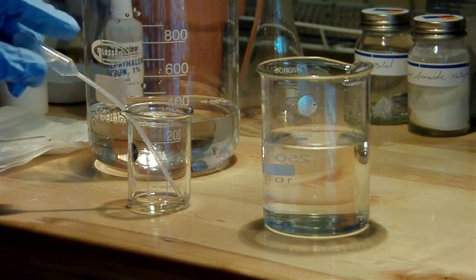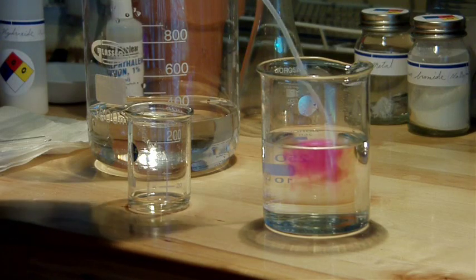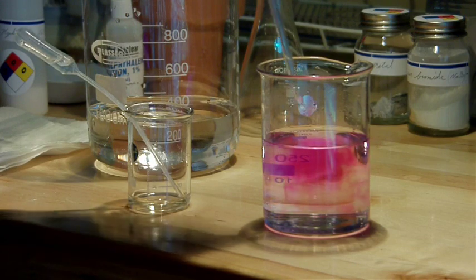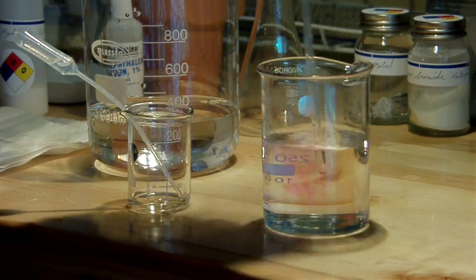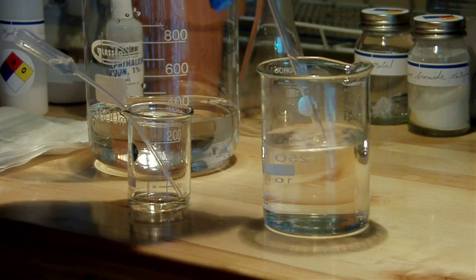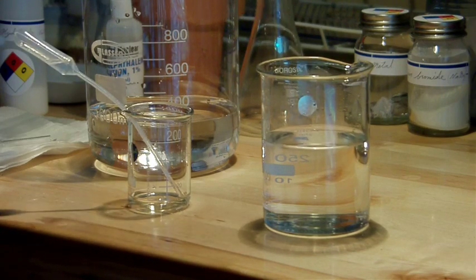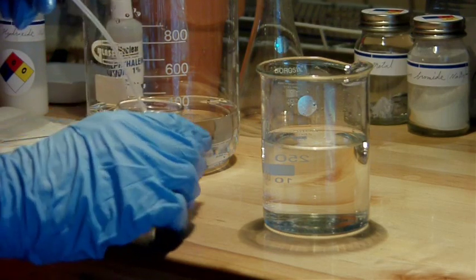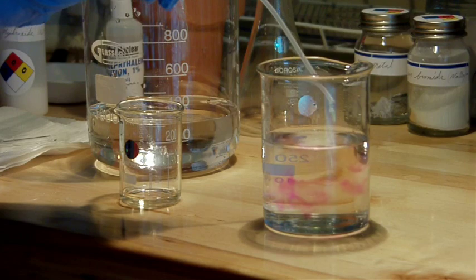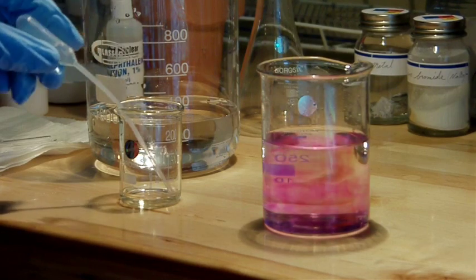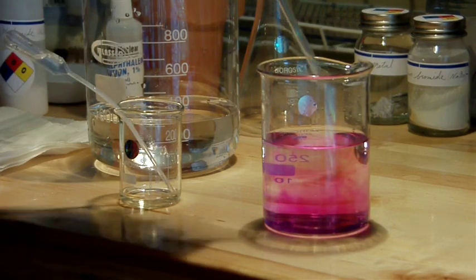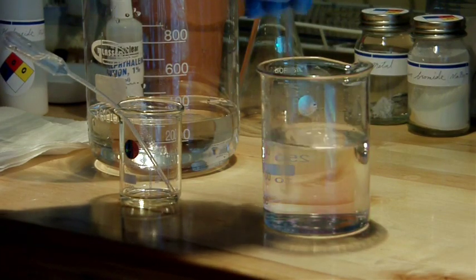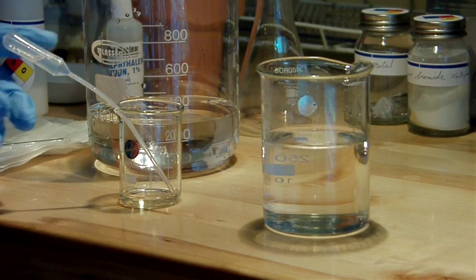Close, but not quite. I'm running out of solution here, hopefully I made enough. That's really close. A couple more drops should do it.